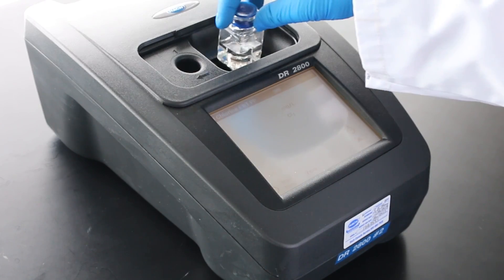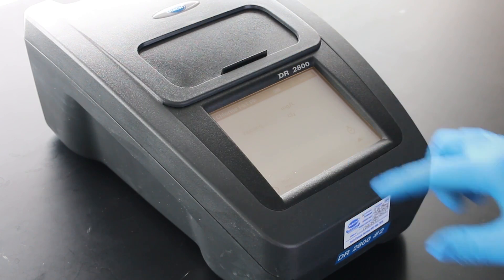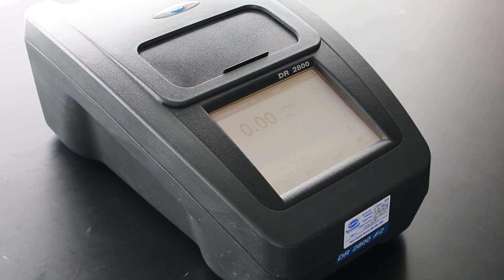Insert the blank cell into the instrument according to the method instructions. Zero the instrument.